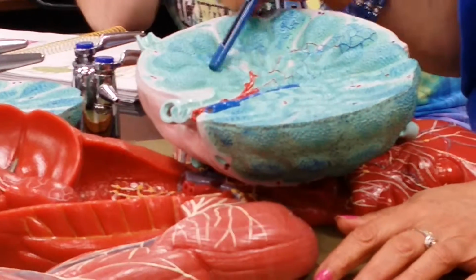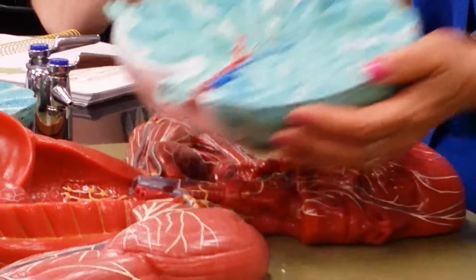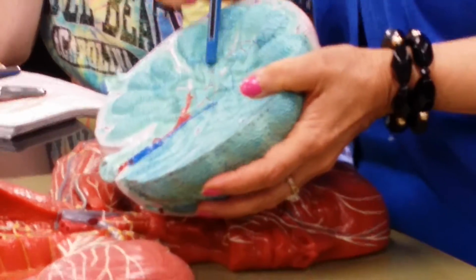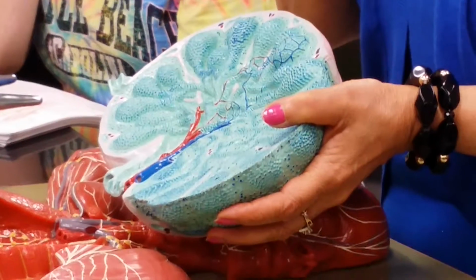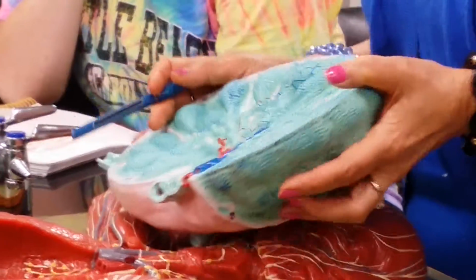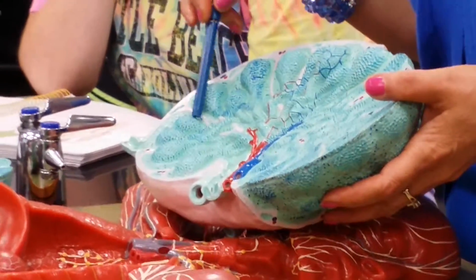Check the medulla out. As you go to the medulla, do we still have cortical nodules? No. Right? You don't see those in the medulla. Instead, the tissue of the medulla is in the form of cords, in the form of strings of cells. These are therefore called medullary cords. This is a medullary cord, and another medullary cord, and another. This is the cut view of a medullary cord. See how these go? These are medullary cords. This is a cortical nodule.